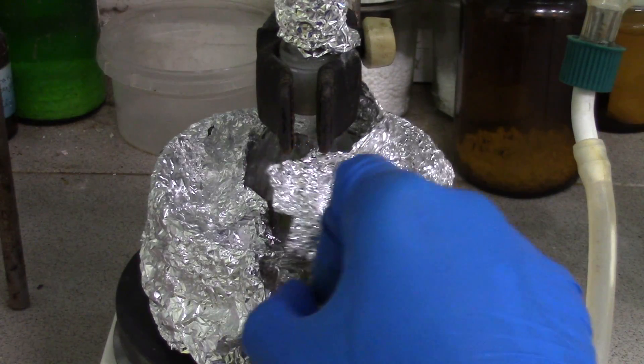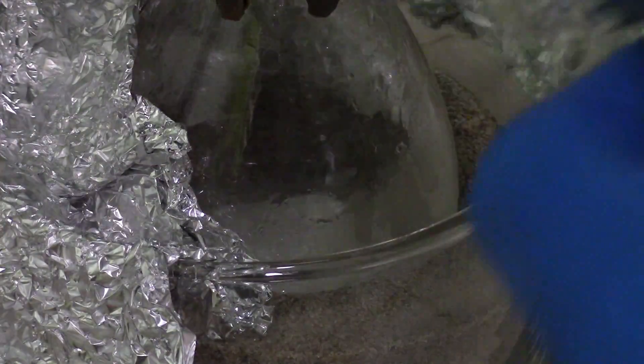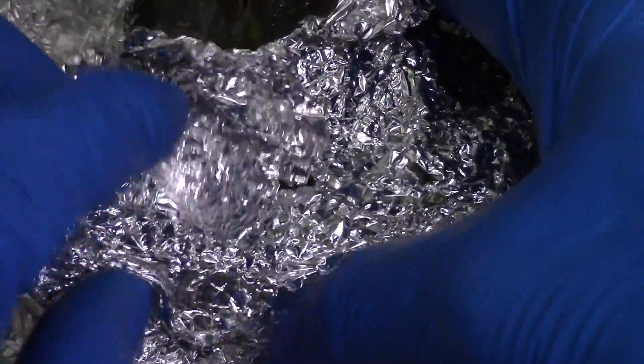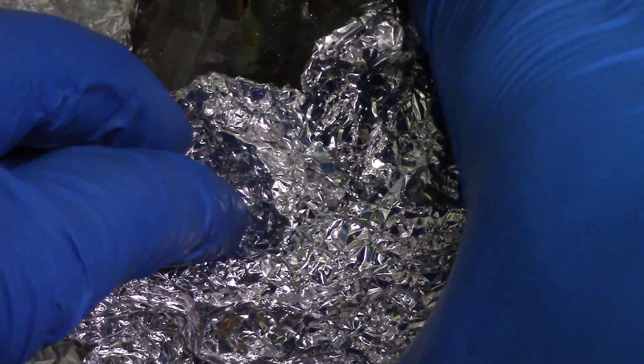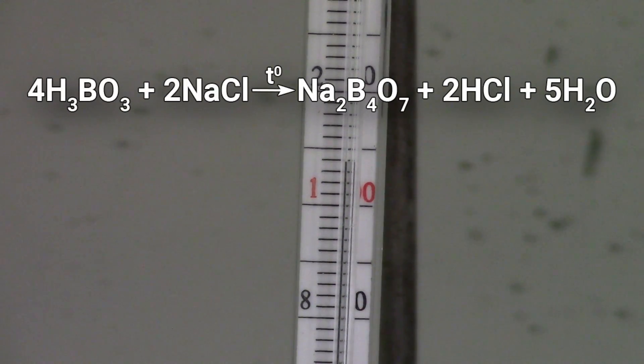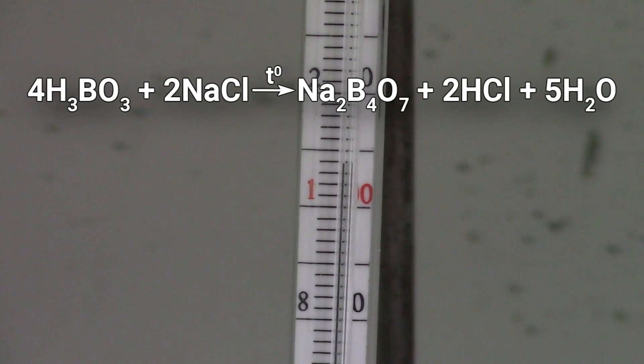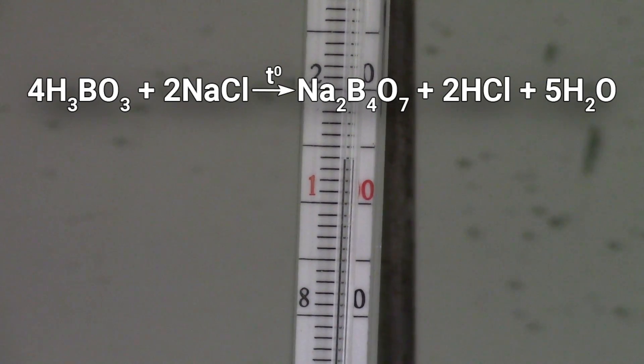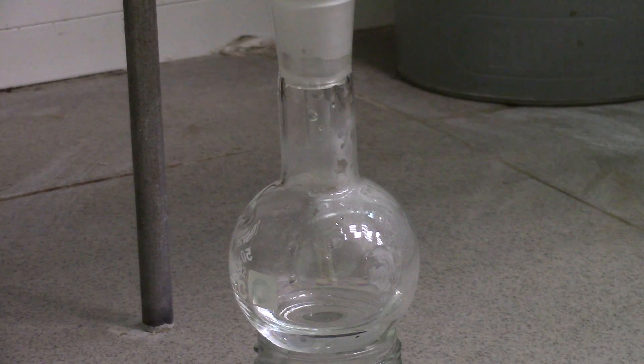So what happened in our reaction? Generally, we use sodium tetraborate for hydrochloric acid titration by varying pH during boric acid formation. But that process could be reversed in solid-state reaction conditions. The reaction presented on your screen is going right until hydrogen chloride solvated in water could leave the reaction space, in my case during distillation process.